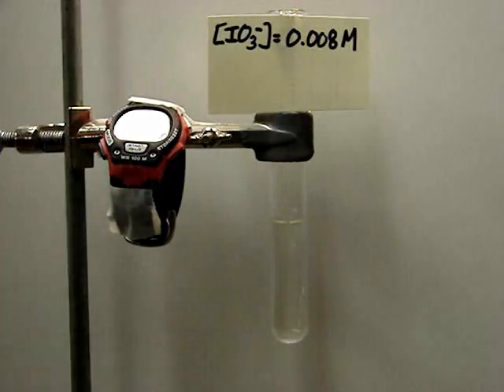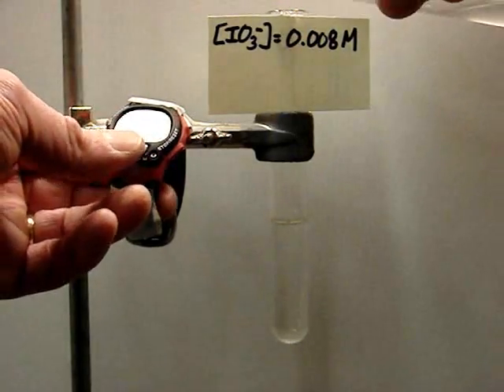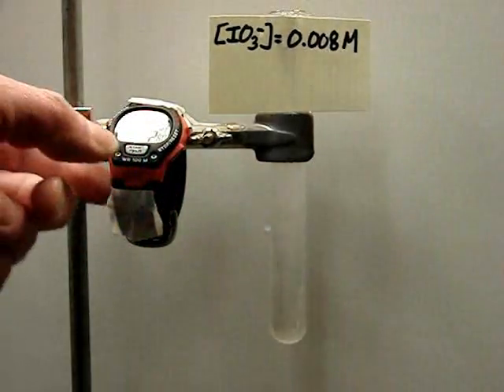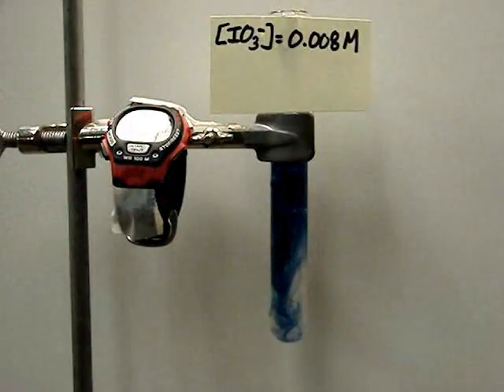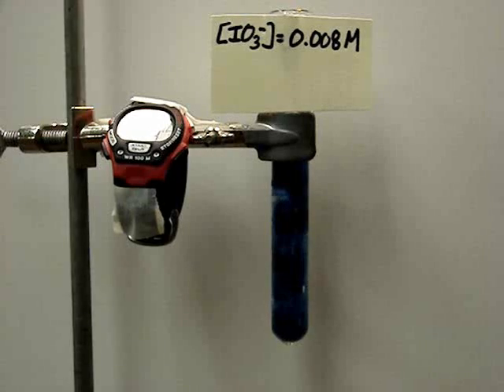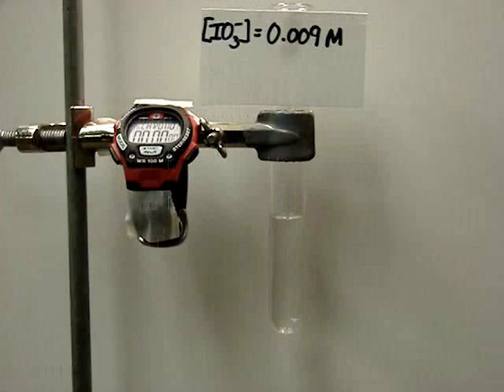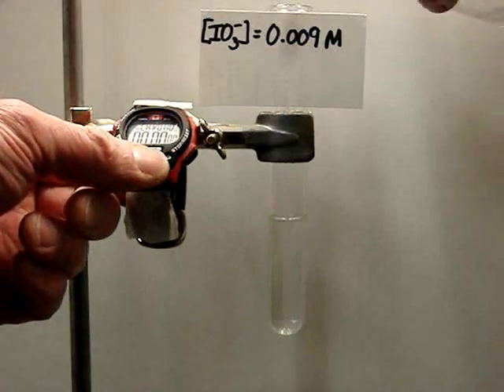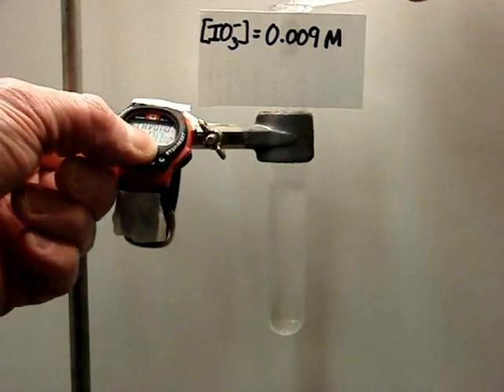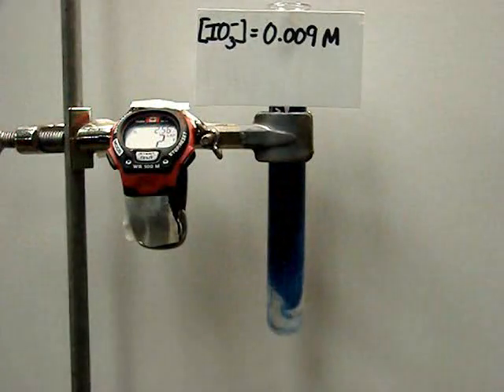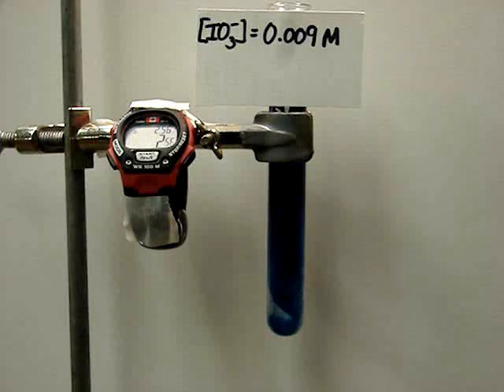Here's 0.008 molar. Now we have 0.009 molar IO3-. Start. This time it's about 2.56 seconds.